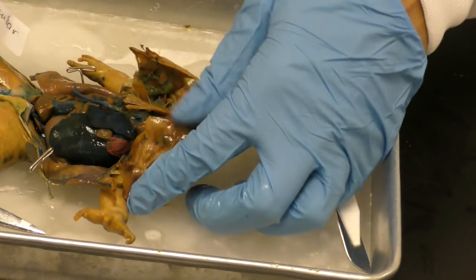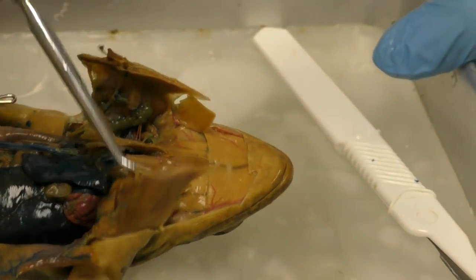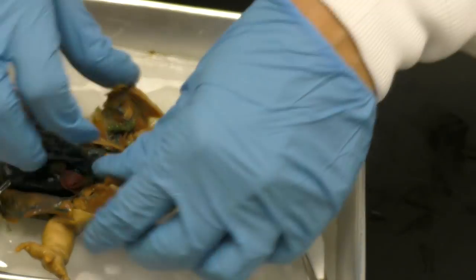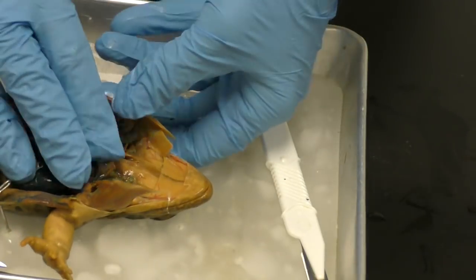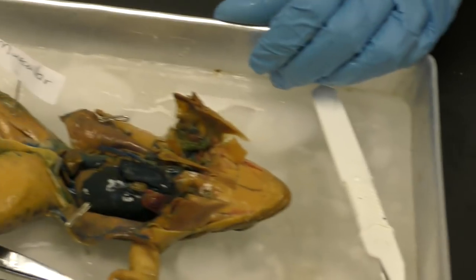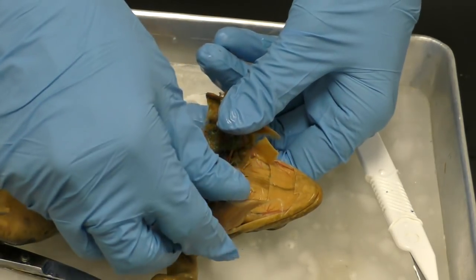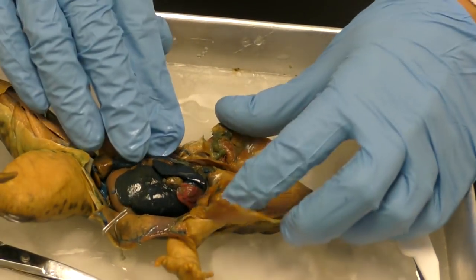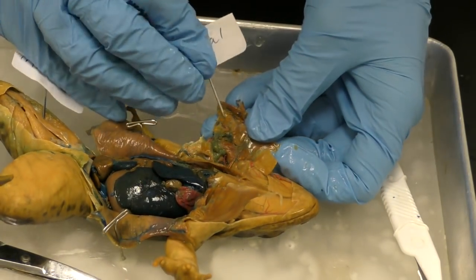Okay, so this part is really hard, and you probably heard me snap it and break it. Okay, and I am not able to put a pin through that system. It's so hard. Okay, so what we're gonna do is have you tell me what the system is that houses our ribs and our femur and our, I'm sorry, I'm drawing a blank, our skull, okay? So all of our bones. What system is that? Right, and if I can, I'm going to label it. I hope you guys said skeletal system.